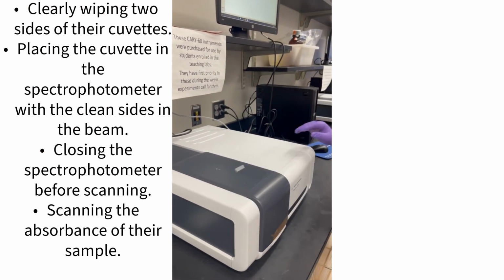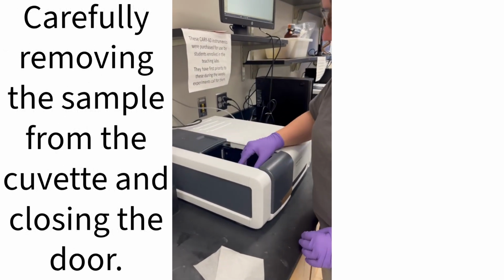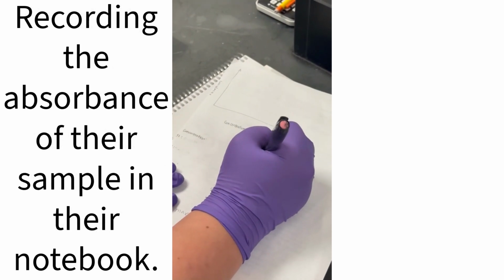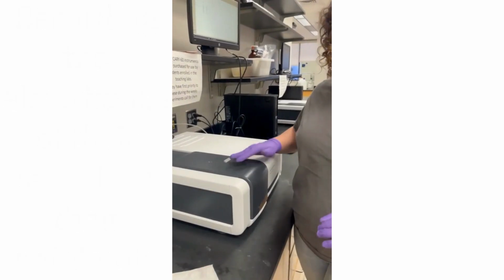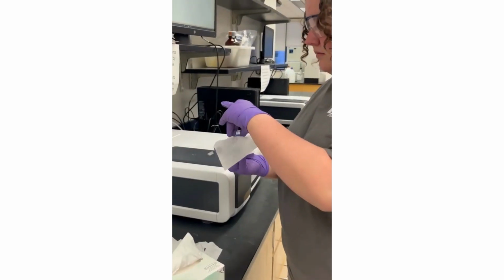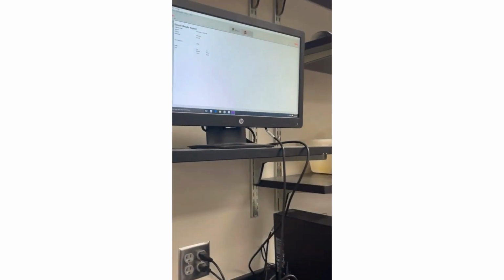You can save it as whatever you want as long as it's not inappropriate and we can remember. Okay. So first, don't press start. You all know what to do with zeroing. Go ahead. That just basically says zero. That is why, because basically when you did this, you can zero with that and then the other one.